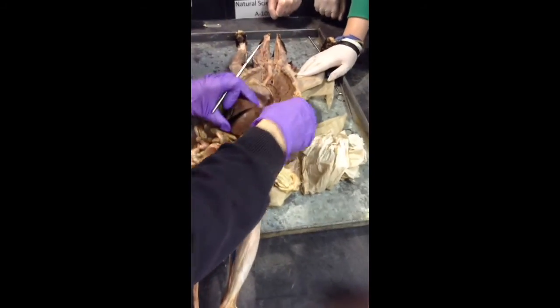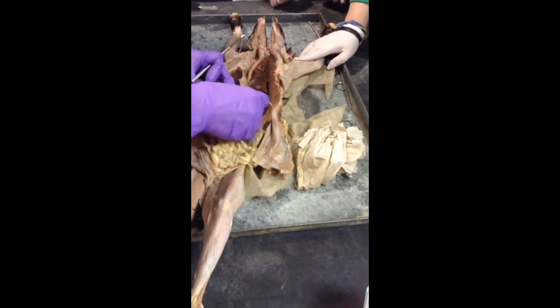All right, so has this guy got his pancreas intact?